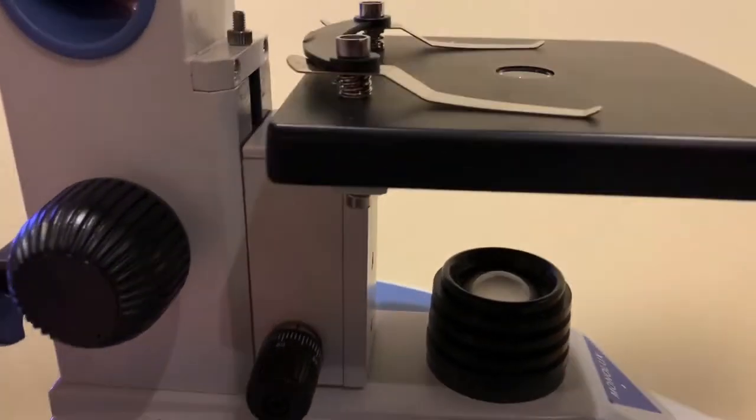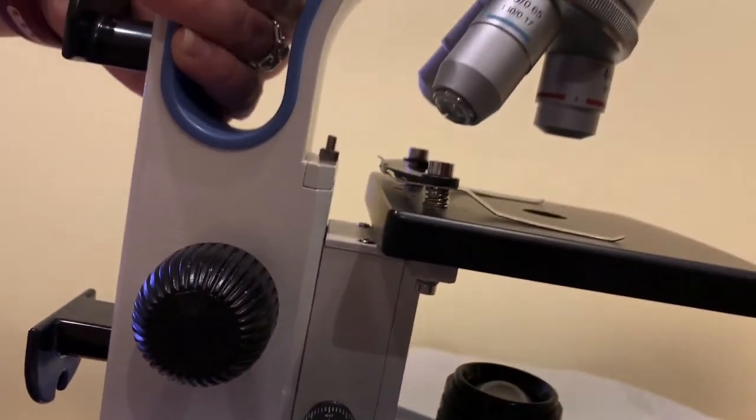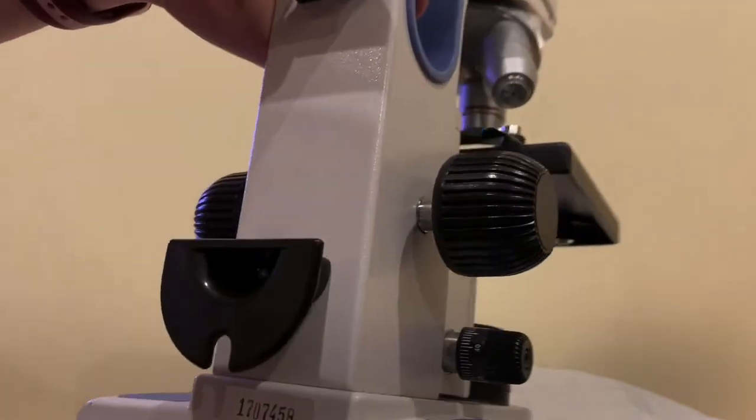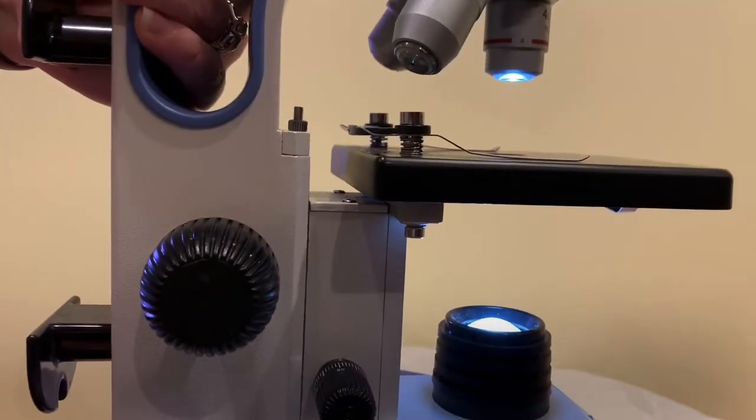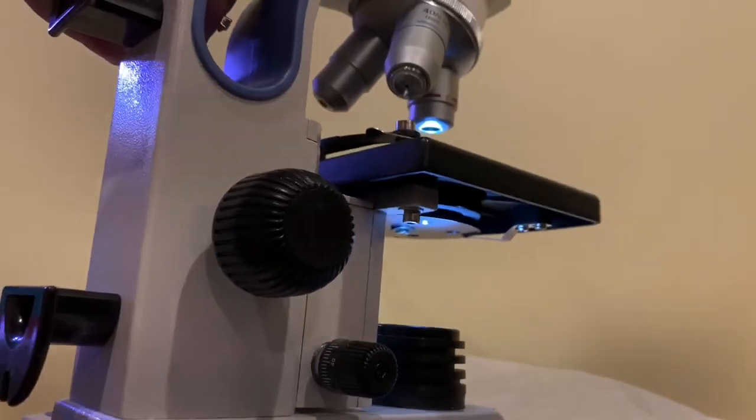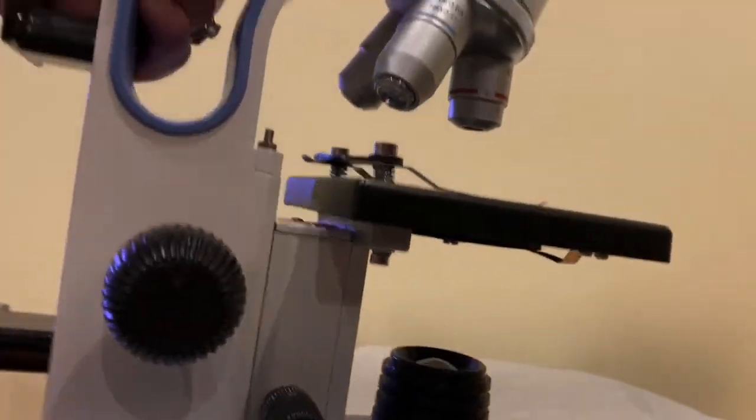So the first thing you should always do when you go to use a microscope is turn it on. Okay I'm going to turn it off right now to conserve some battery power.